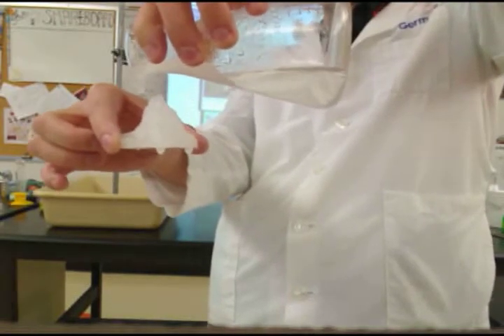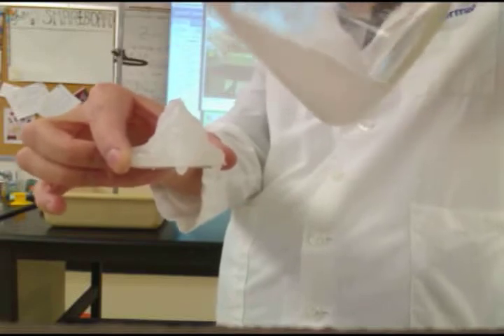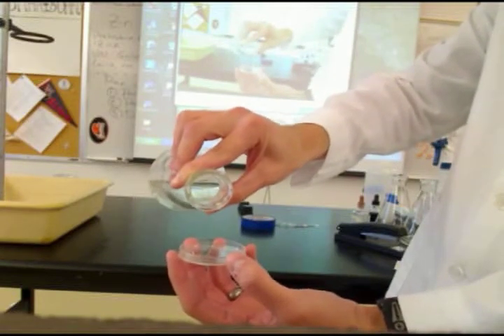Anyways, and you can see it's cooling off. The crystals move down the beaker or a flask. Oh, whoa! I didn't notice that. Oh, what the heck? My gosh. So it's made a pile here and a little waterfall out of there. Let's see what happens when I pour this into here.